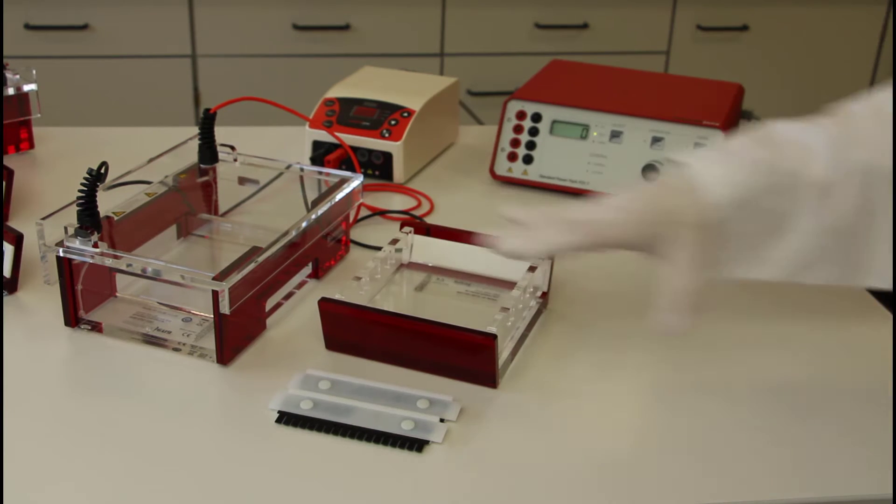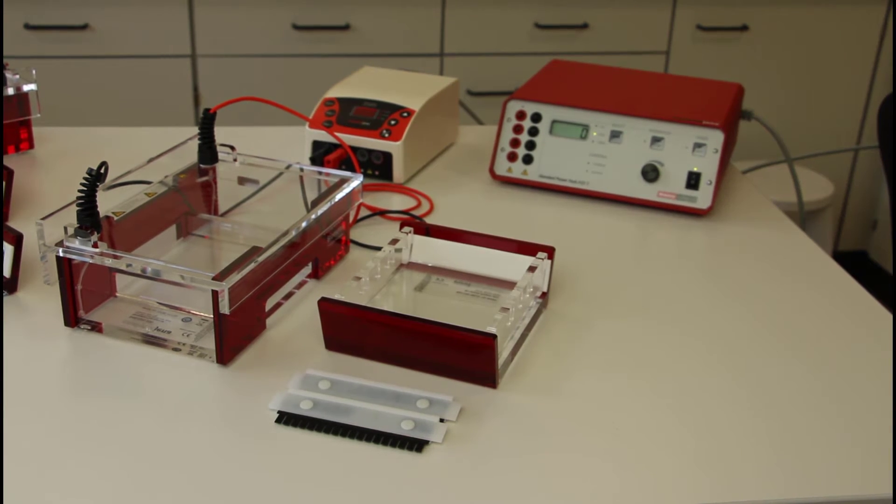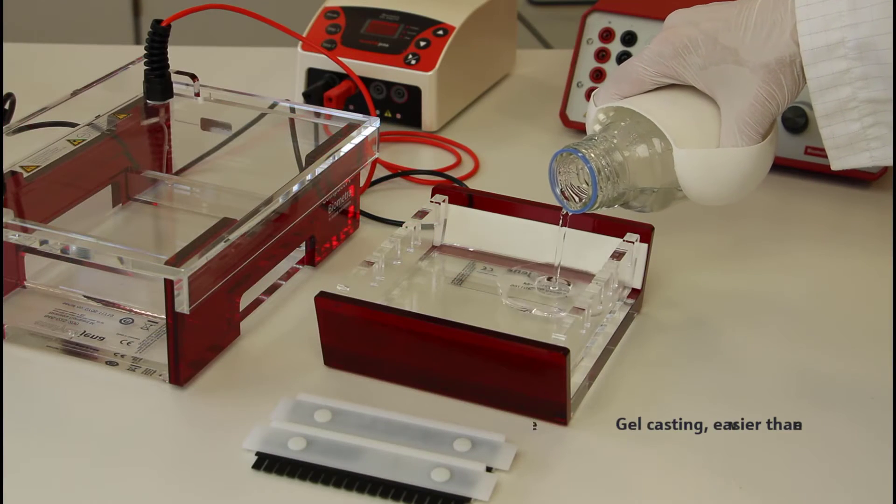Simply place the gel tray in the casting system. Fill in the melted agarose and done.